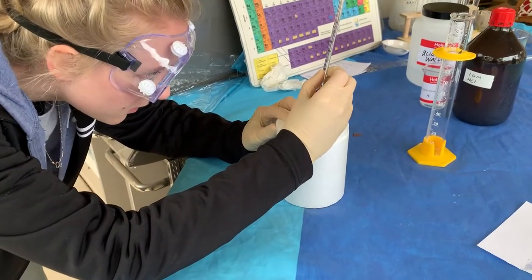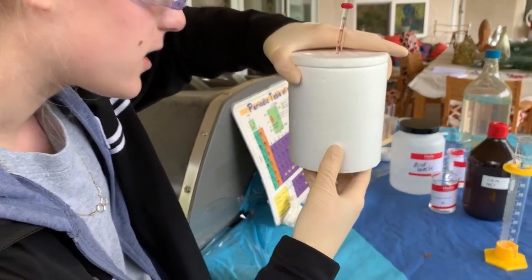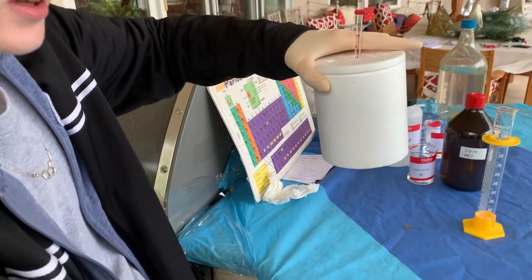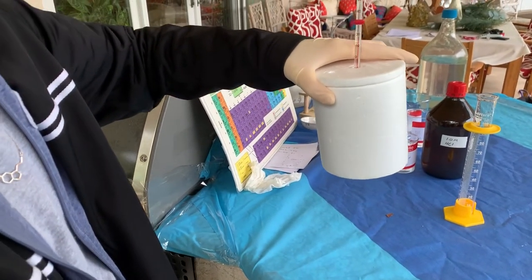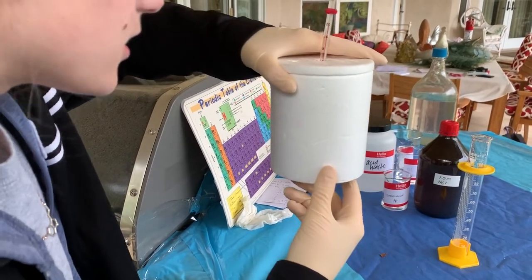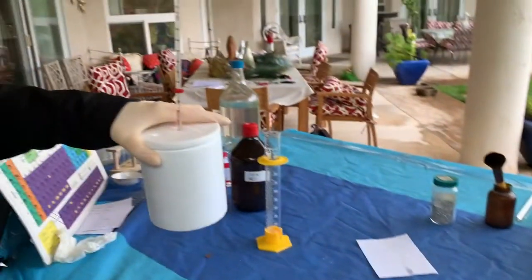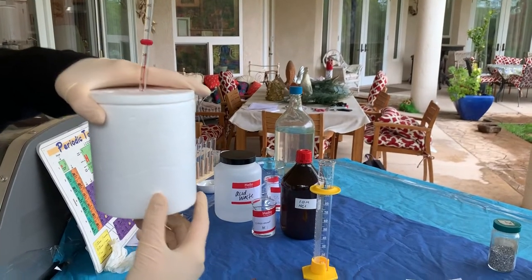Can you write these down? This is going to be kind of fast. 12 degrees Celsius. It's been another 10 seconds — we're at 18 degrees Celsius. Another 10 seconds: 20 degrees Celsius. Then 22 degrees Celsius.